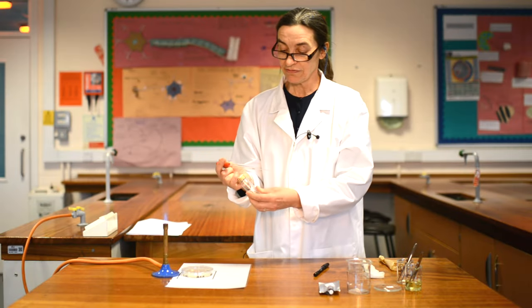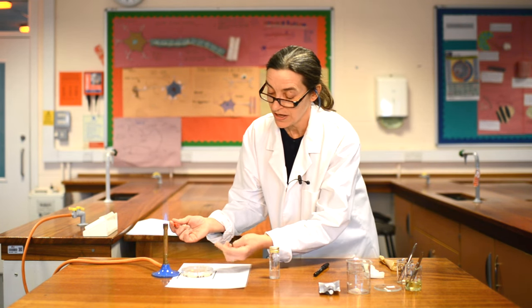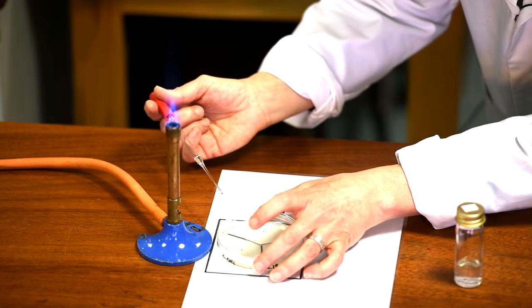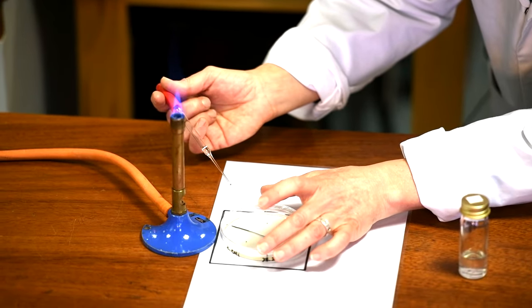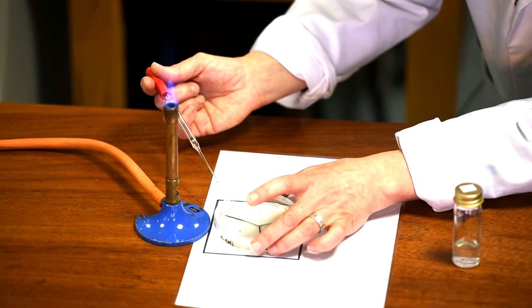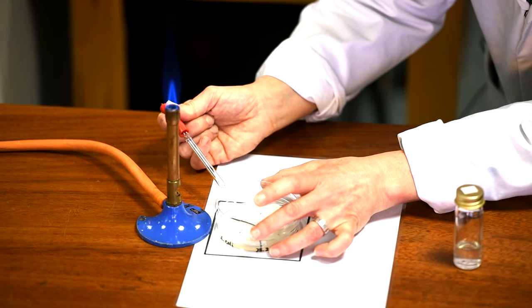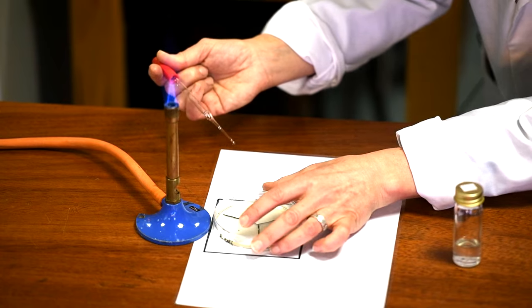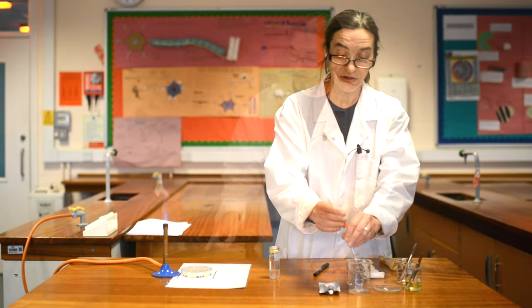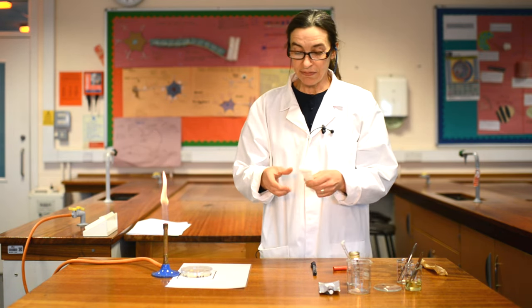When you do this yourself, it's your hand. I've got my agar plate the right way up — this is the lid. I'm going to open the lid for the minimum amount of time and squirt my culture of bacteria onto the plate. Minimum opening, minimum time, squirt, close. And now my pipette goes into my discard bottle. At the moment my bacteria culture is just lying in the middle of my plate, so I need to spread it.